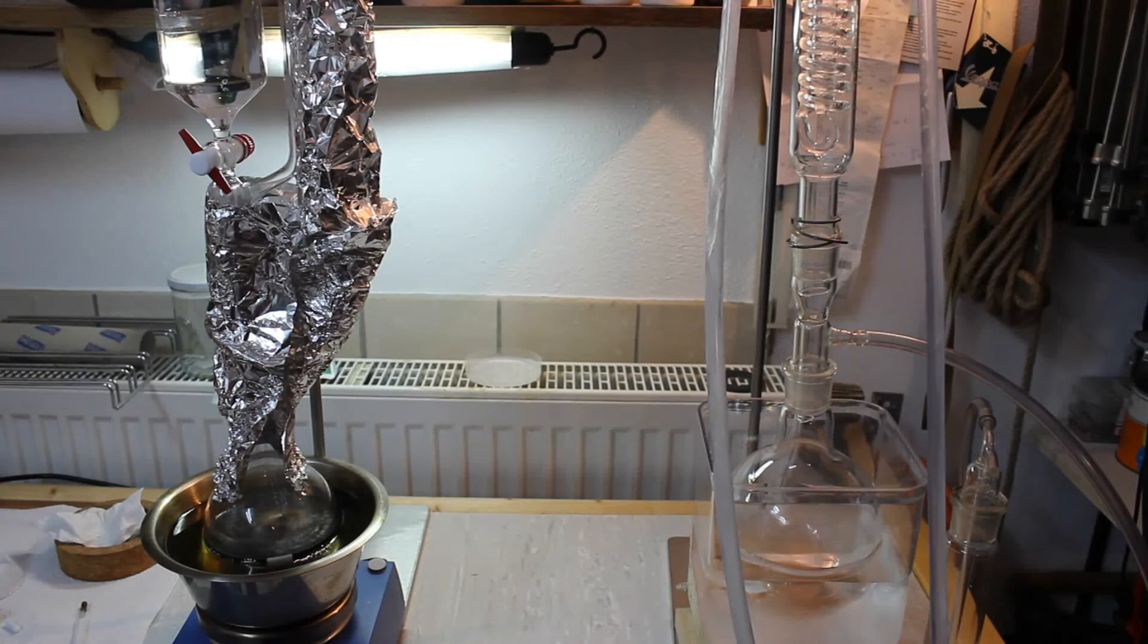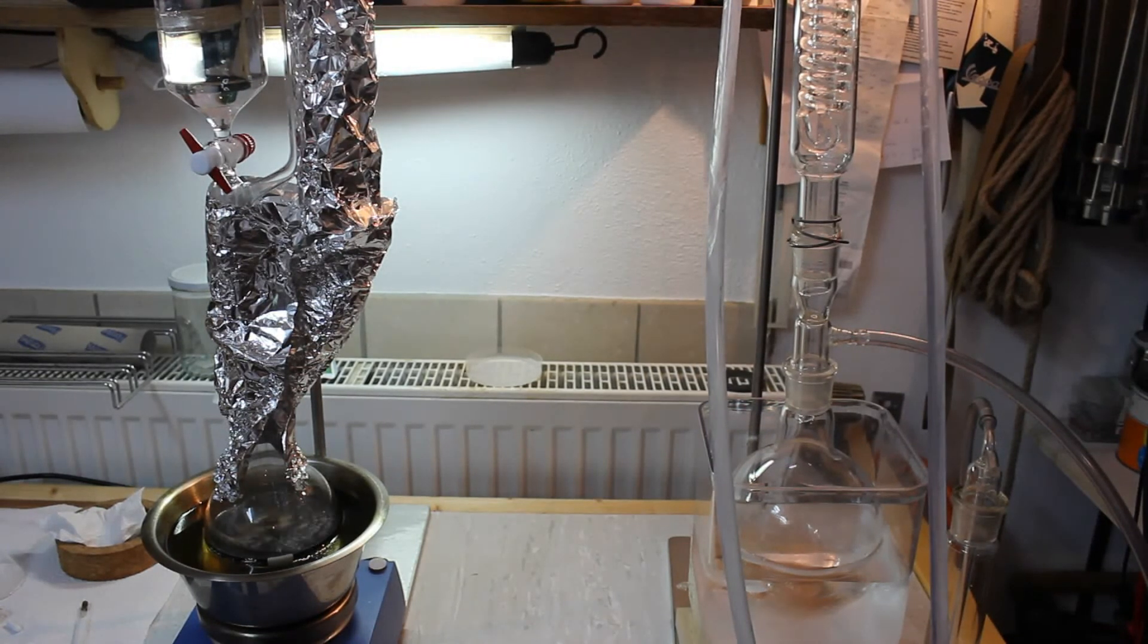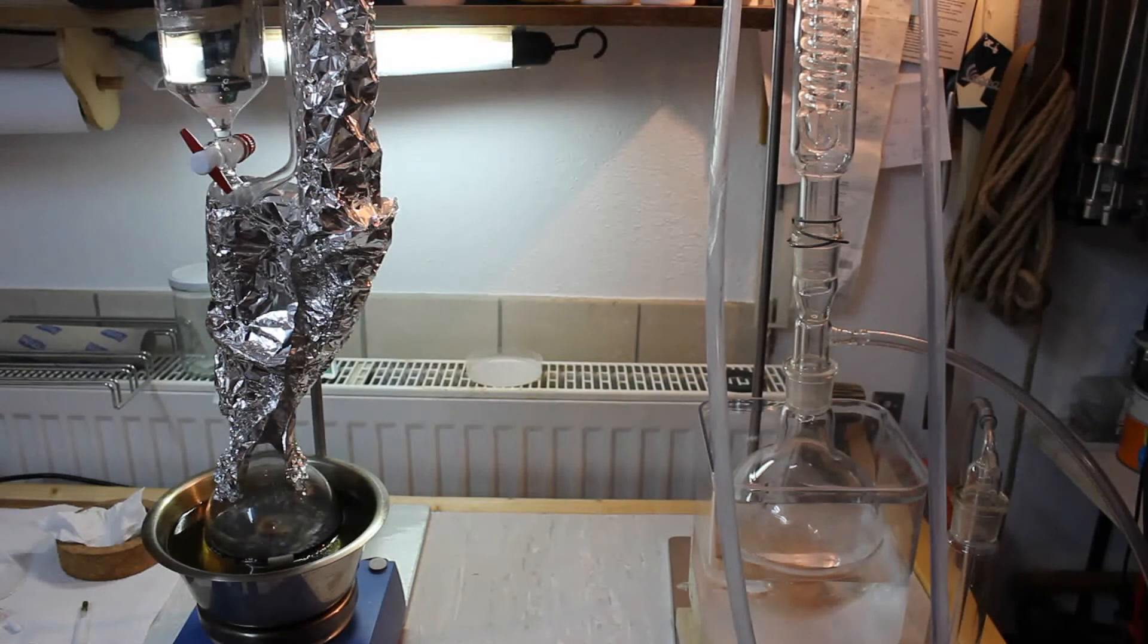Here we are a couple of minutes later and the distillation is now really going. The stillhead temperature currently reads 35 degrees Celsius which corresponds very well to the theoretical 35 degrees Celsius boiling point of diethyl ether.